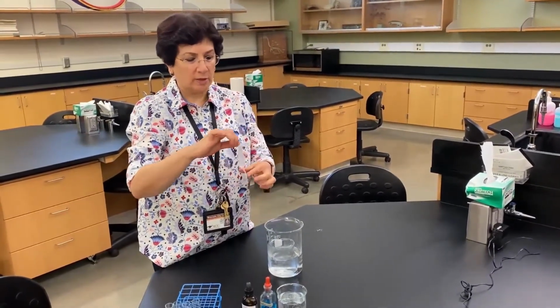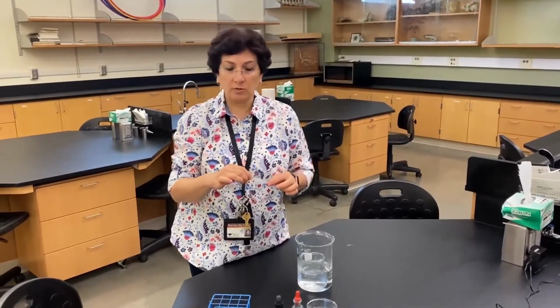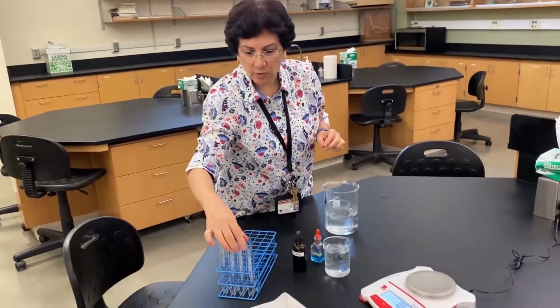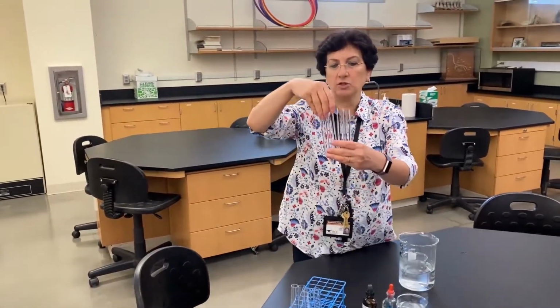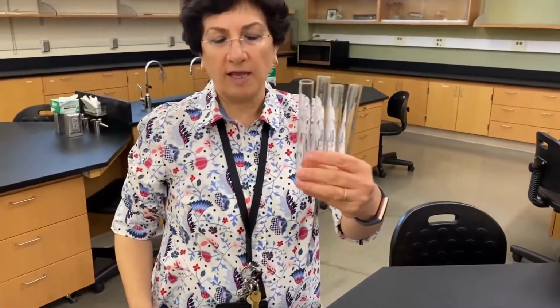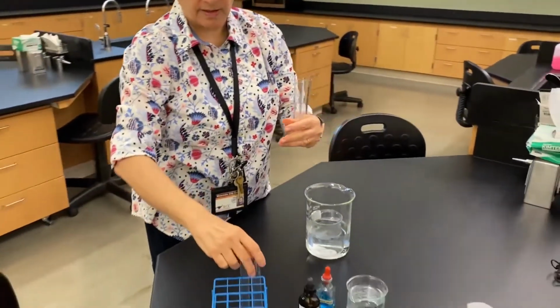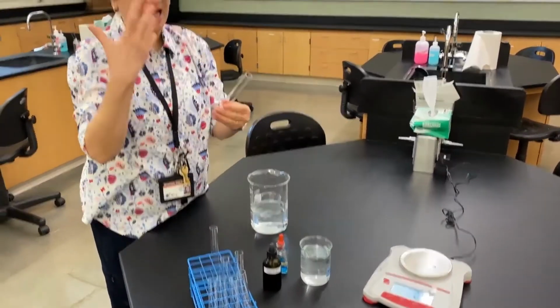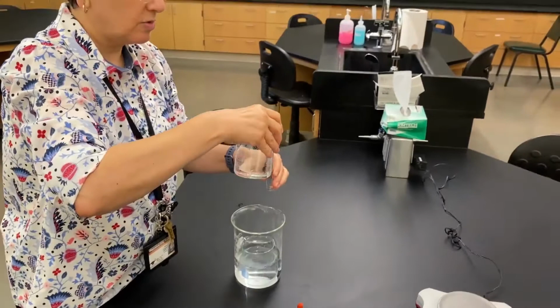Now we're going to test for dialysis. And the way we're going to do that, if you were in lab and you guys are working in groups, each group would have 4 test tubes, and we're going to use 2 of them to pour water from the beaker. So this is in your lab manual, this is what we call outside. So this is outside water.